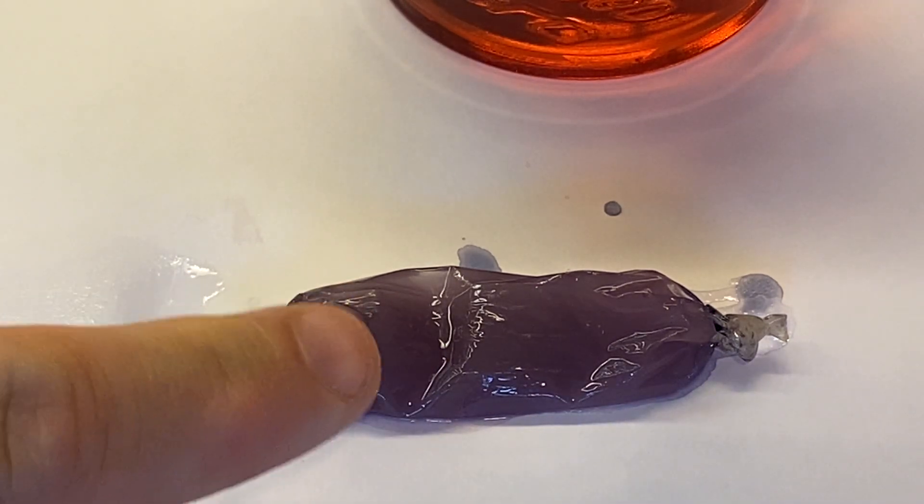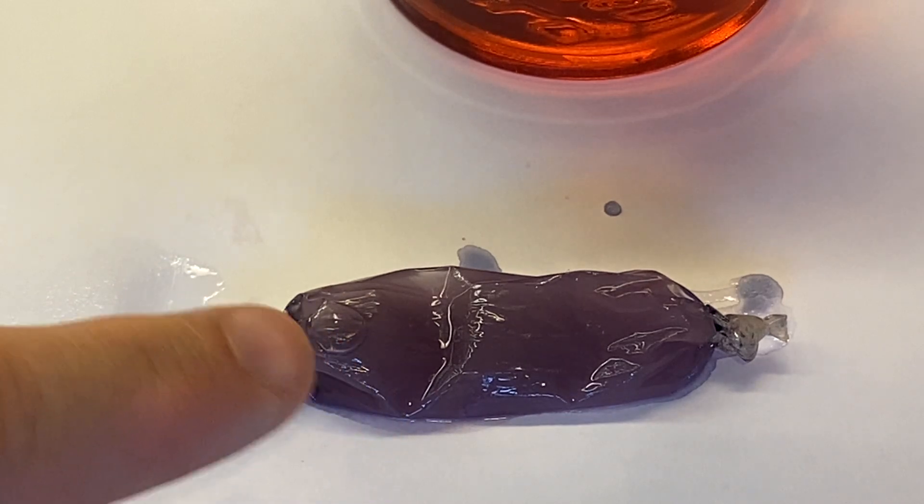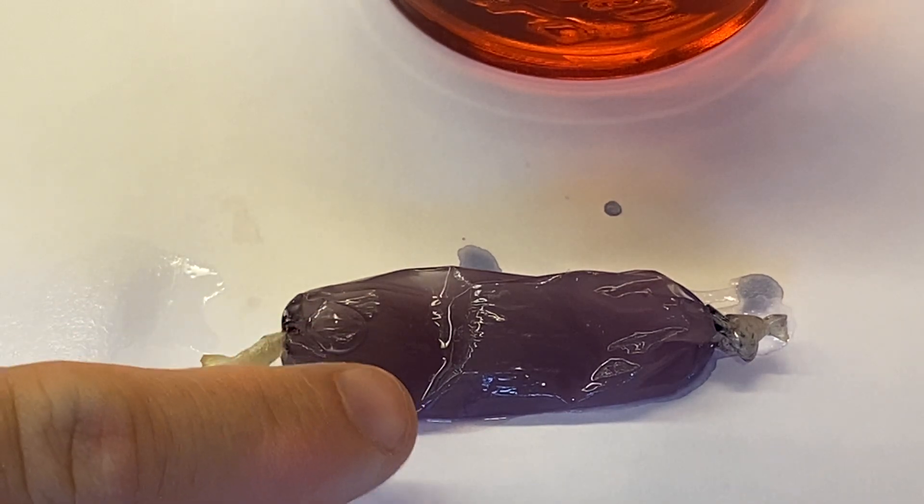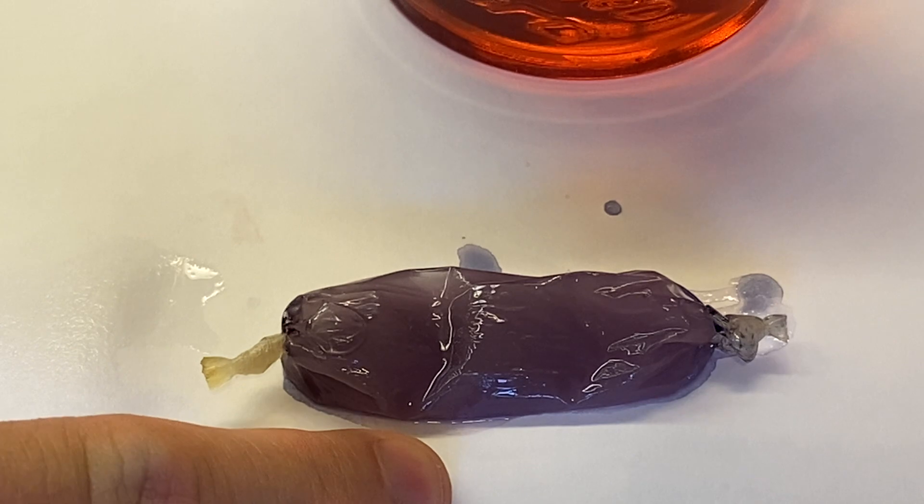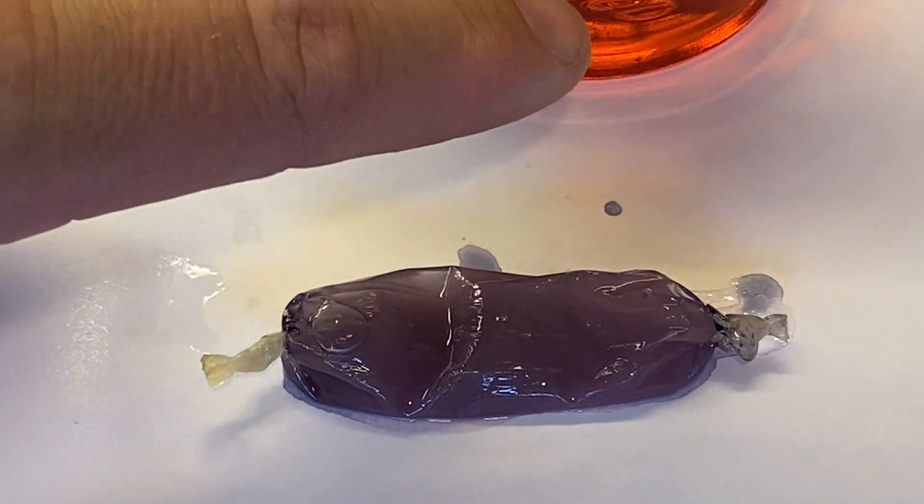It also turned the inside of the cell purplish, well almost blackish when I first got it out. Now it's mixing in. This purplish color is an indication that there is starch in the cell still. However, once again, there's none in the cup.